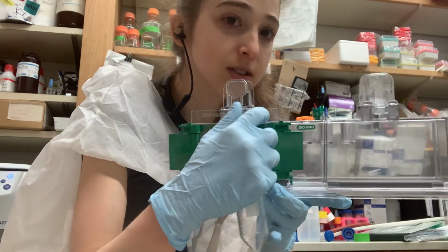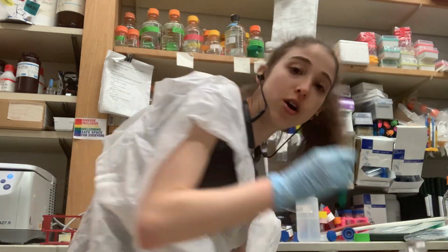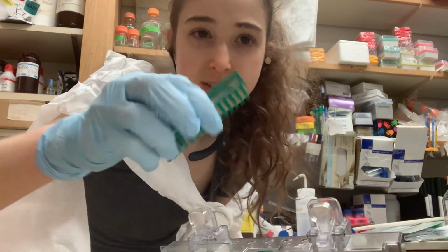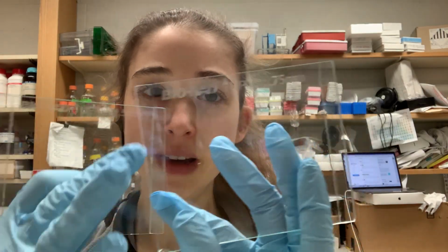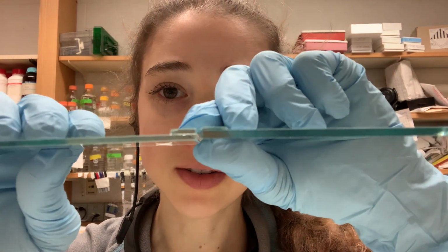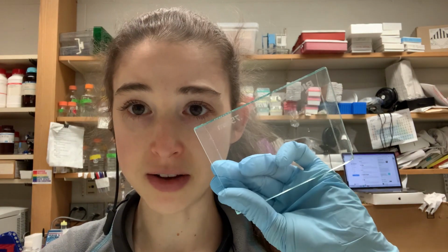And then you can add your stacking gel, and when you add your stacking gel, you want to have your combs ready. So we have different size combs, with different numbers of wells. We have 15 wells and 10 wells, and then we have 0.75 and 1.5. So we have these two thicknesses of plates, 0.75 and 1.5. The thickness difference is in the glass spacer. So the 1.5, this one, is going to have a thicker slab of gel than the 0.75. So you can use either depending on how much sample you have, how much you want to load, and all of the various things like that.